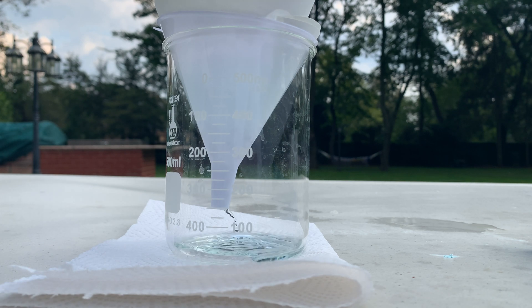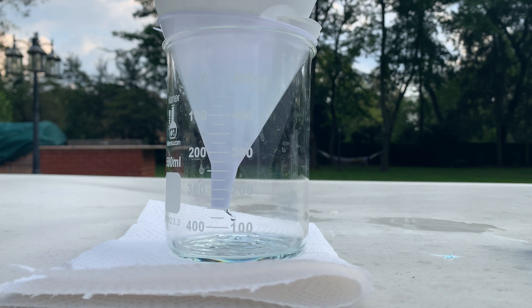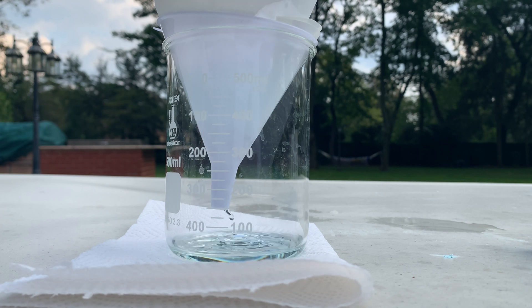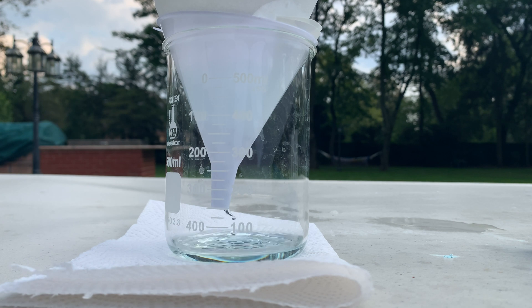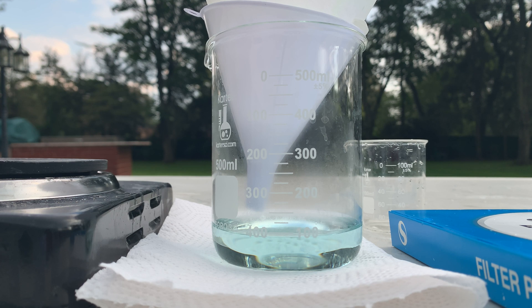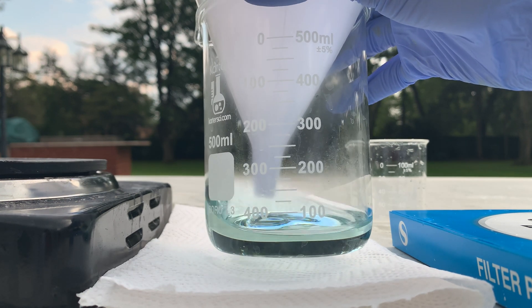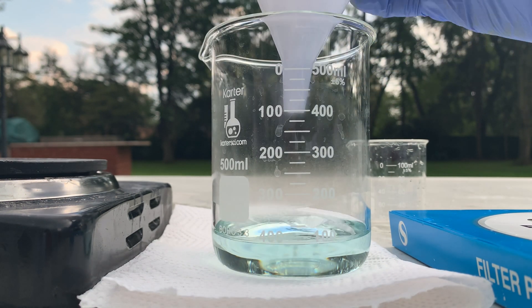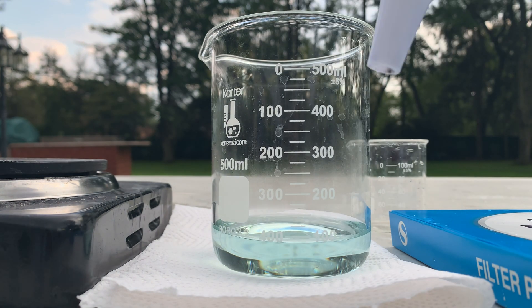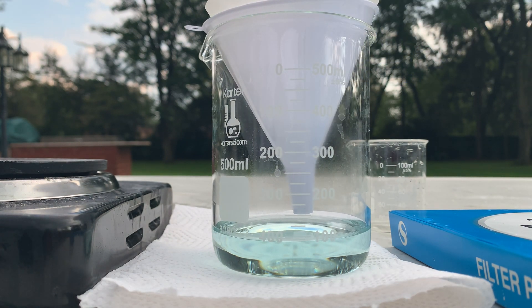This is probably all just excess salicylic acid that I'm putting onto the filter paper, but I'll add it just in case. The solution is basically done filtering. The liquid at the bottom is a nice light green, which should be the color of copper salicylate, and the solid we got on top is a white powder — probably some unreacted salicylic acid. The copper salicylate is likely still dissolved in the liquid.